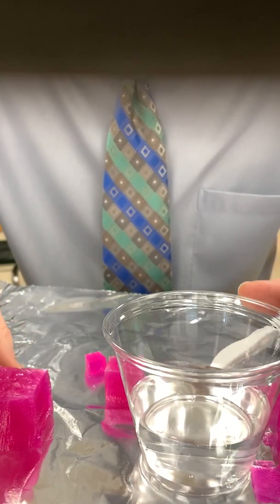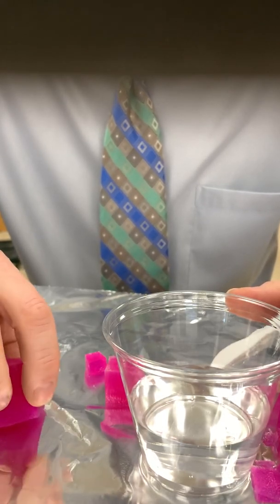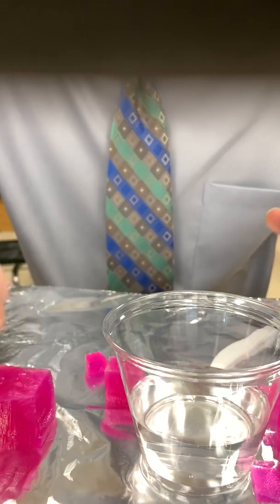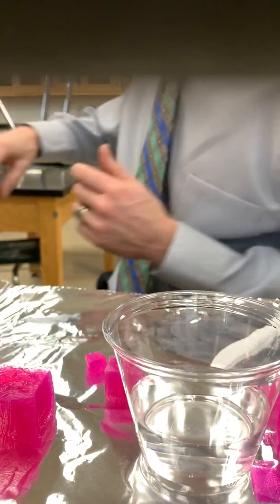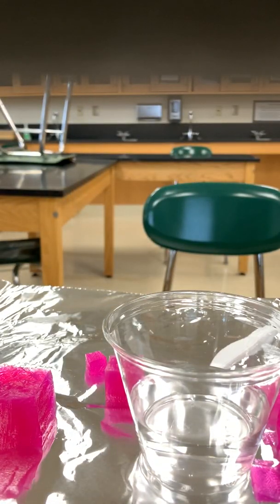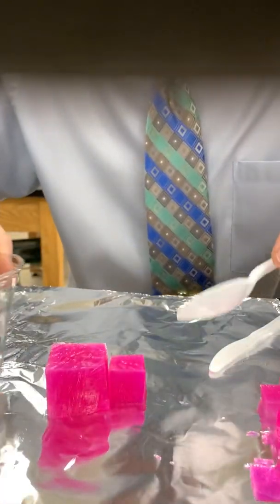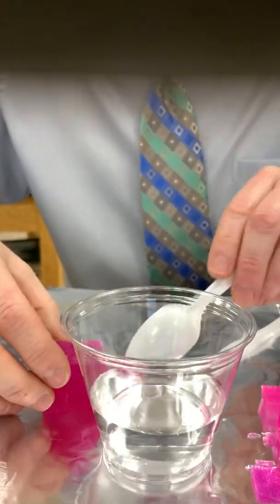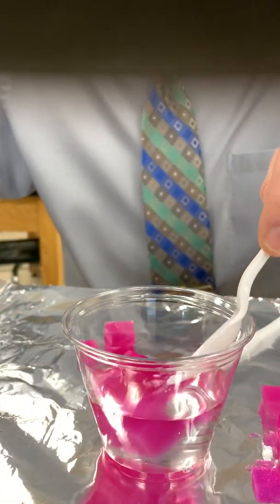So I'm going to put this one in the hydrochloric acid solution first and let it sit there for maybe a minute or two. There should be a spoon here that we should use. Let me go get a spoon. Now when using the spoon, this gives you the ability to pick this up and put it in there just like that.